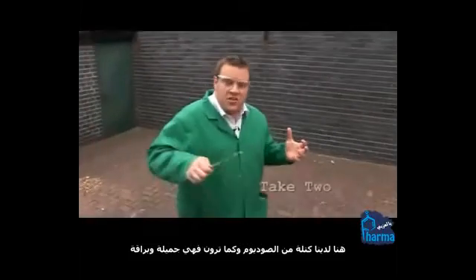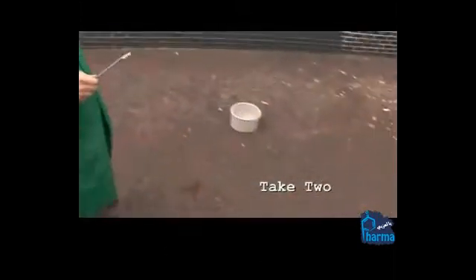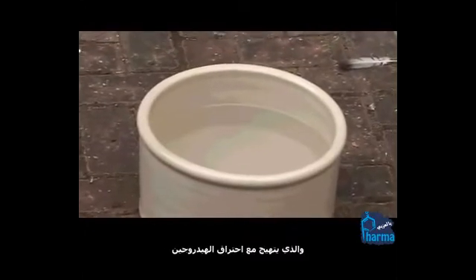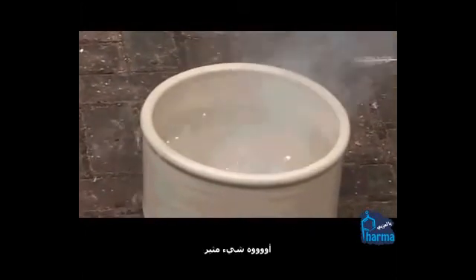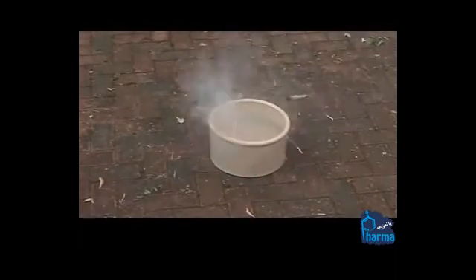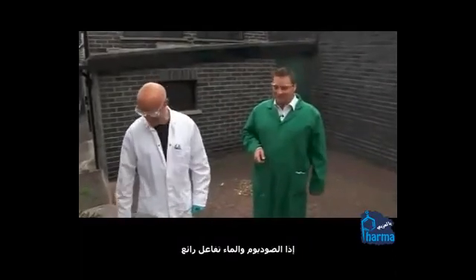We've got another lump of sodium — you can see it's really nice and shiny. We're going to pop that into that big bucket of water to see what the chemical reaction is. You can see again the orange sodium spectrum as the sodium is getting excited and the hydrogen is burning. Sodium and water — excellent reaction. That was a much better bottle.